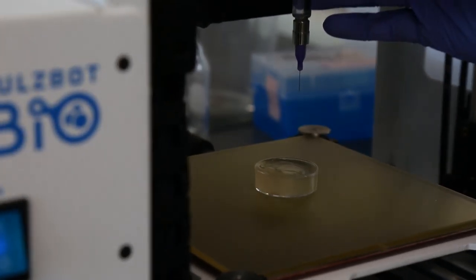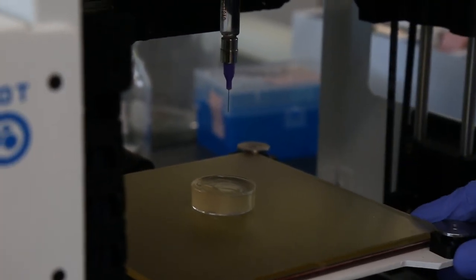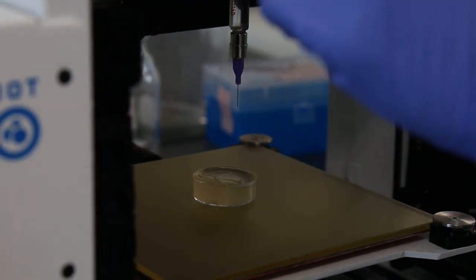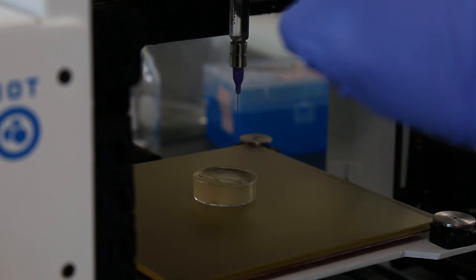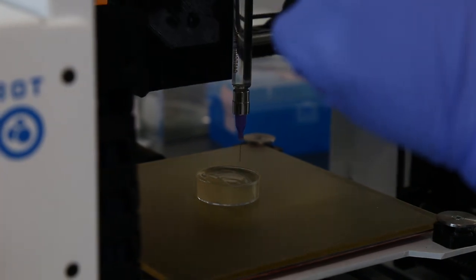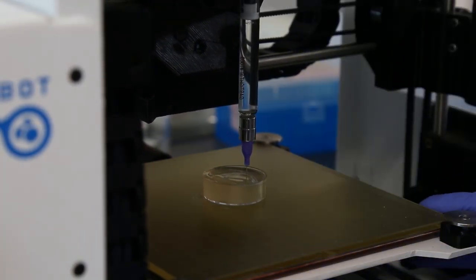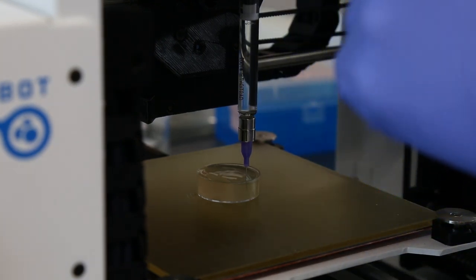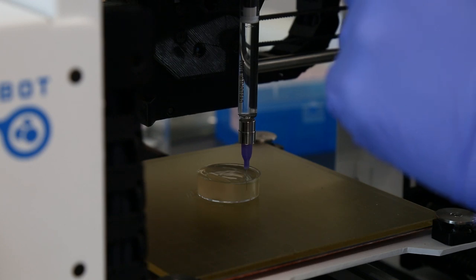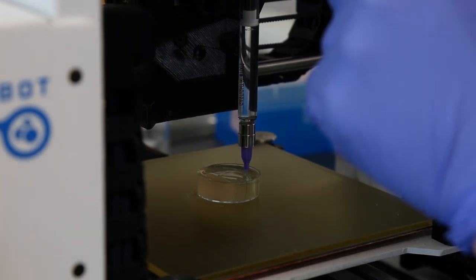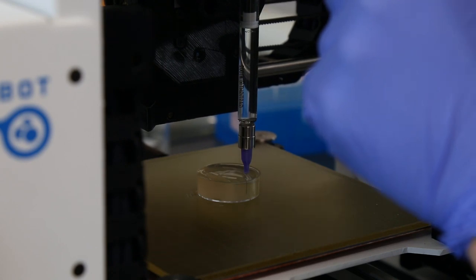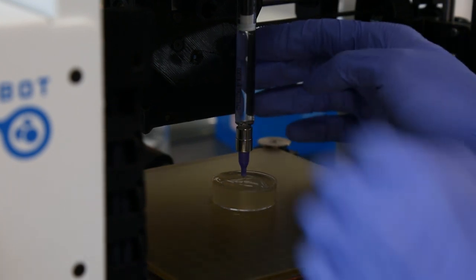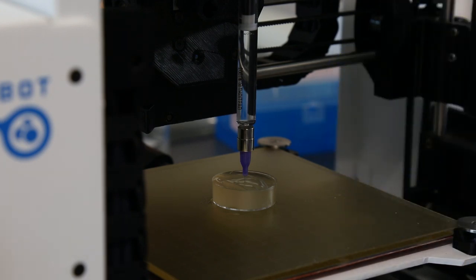All that I have to do now is just manually center the needle. I'm gonna turn the motors off on the bed, and then drop the z-axis until I get roughly to the top of the print container. Once I'm here, I'm gonna move the dish to the front so I can see where the needle tip is. I'm gonna switch over to fine motion control and very slowly continue to lower the needle until it's maybe a millimeter off the bottom of the dish. Then all I have to do is push the container roughly to the center of the dish, and this is where you just press print.